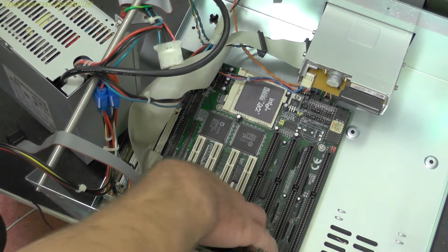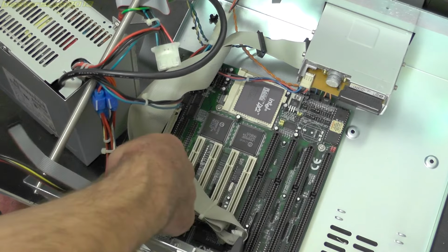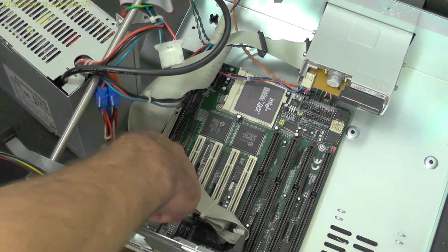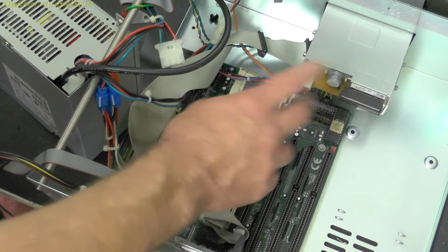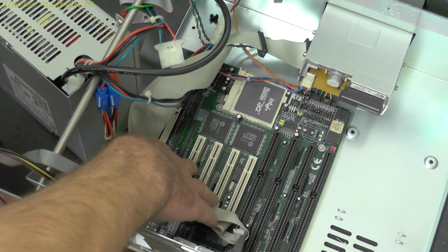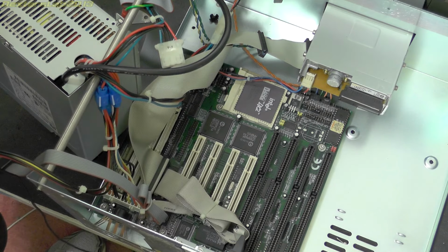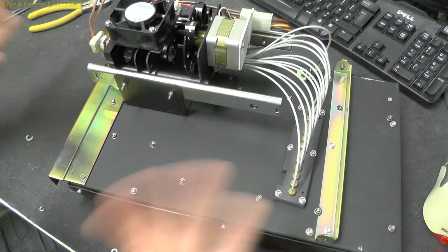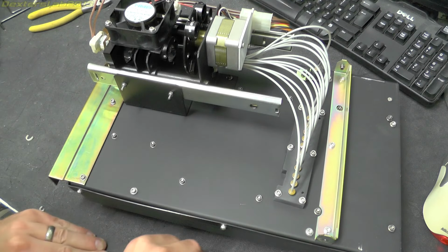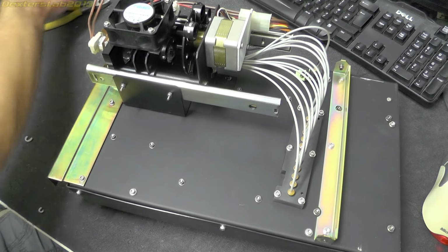So on there we've got 4 SIM slots, the 2 parallel IDEs, serial, the floppy disk cable of course. We've got 4 PCIs and 4 ISA slots. Right, let's have a look at the science section. So I've got it turned upside down here so you can see most of it that way.